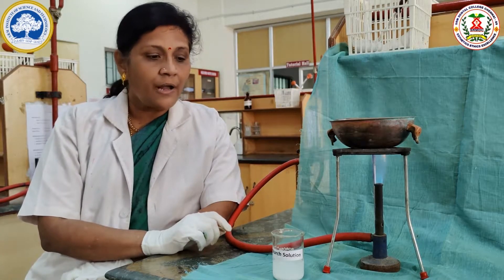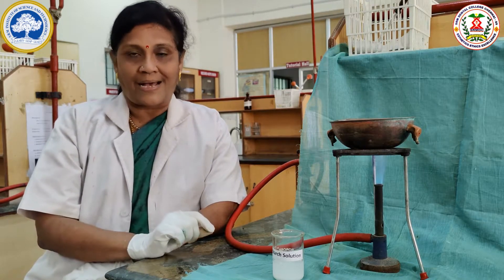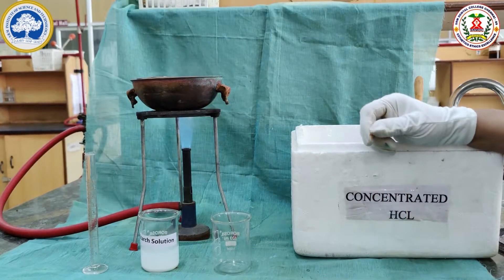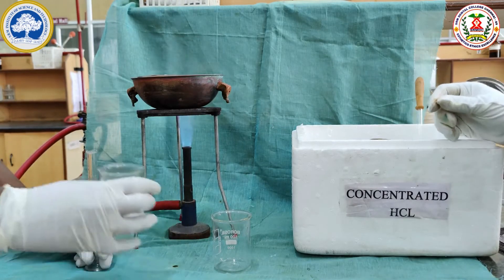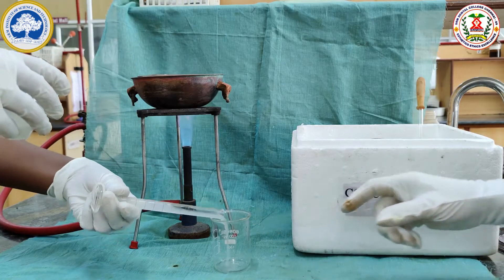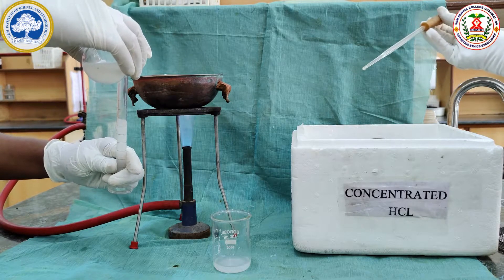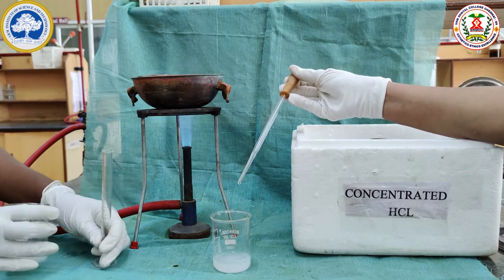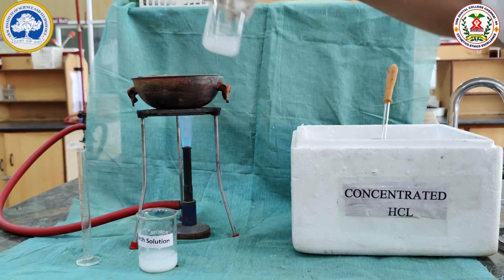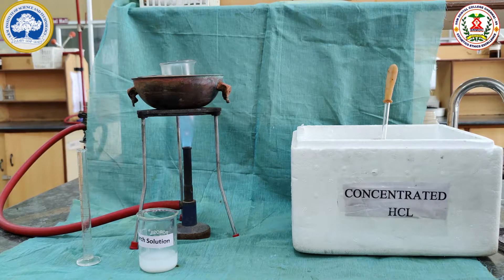So far we have done the tests for starch. Now we are going to do the starch hydrolysis. The starch solution is hydrolyzed by adding hydrochloric acid. The course of hydrolysis is monitored by periodically testing with iodine solution. For acid hydrolysis of starch, we take 18ml of the starch solution in a beaker, and 9 drops of concentrated HCl is added to hydrolyze the solution. This is kept in the boiling water bath, and from the first minute we are going to periodically test the hydrolysis of starch.